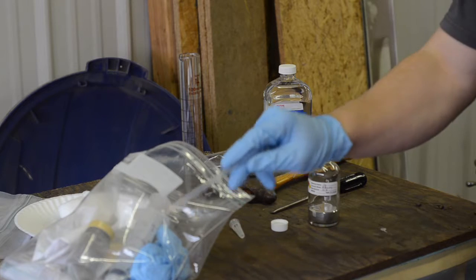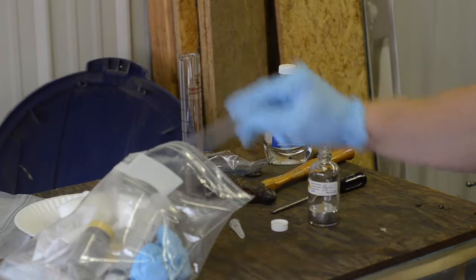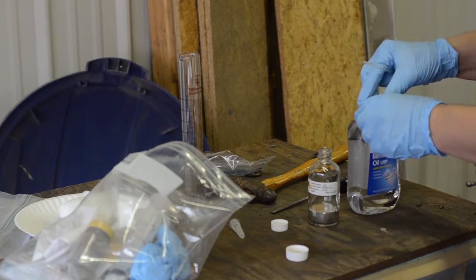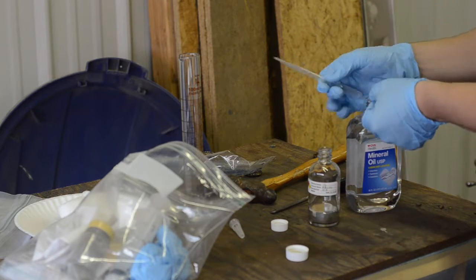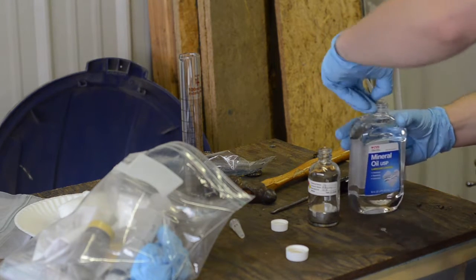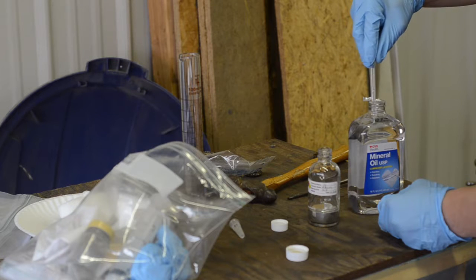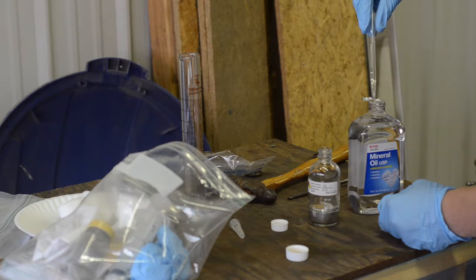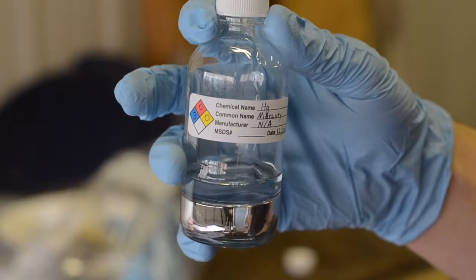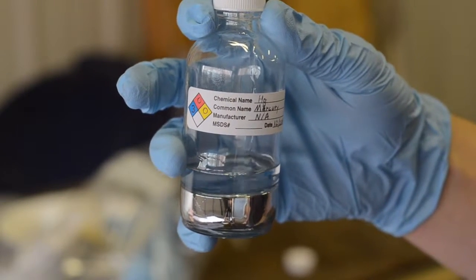All right, so as you can see, we've discarded our filter here. There is a little bit of mercury in there. But like I said, all this is going to hazardous waste disposal, so that's fine. Now, as a final attempt to keep the vapors down, I've got a fresh pipette, and I'm going to coat this mercury with a small amount of mineral oil. And there's our mercury. It looks much cleaner now, and we've got some mineral oil on top there to try to keep the vapors down.